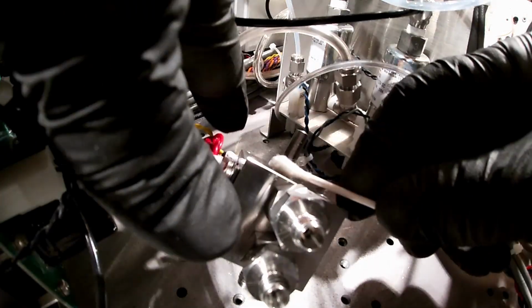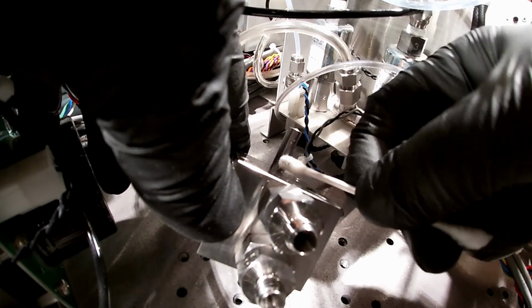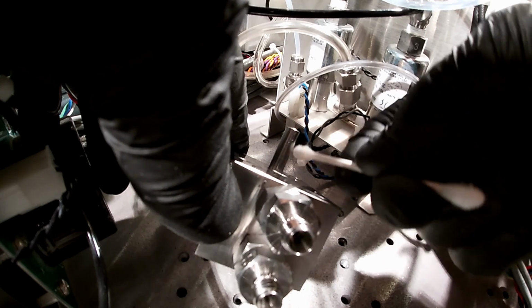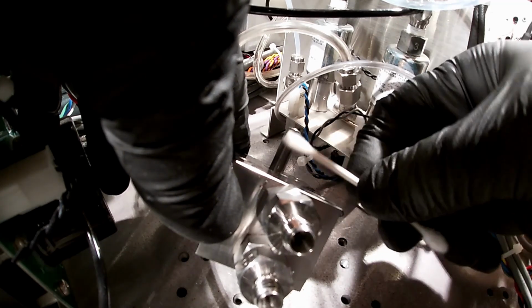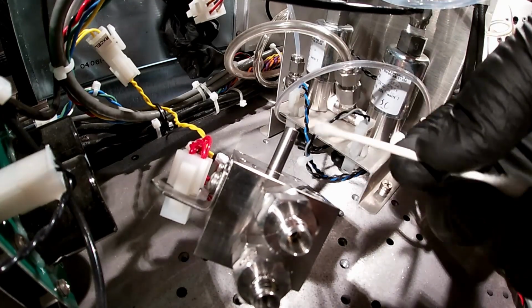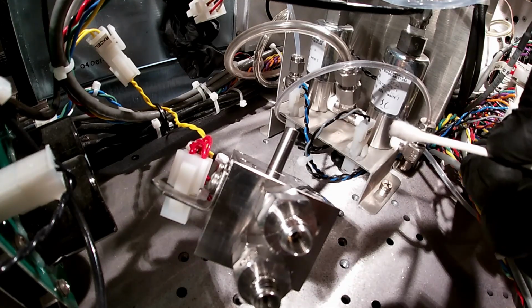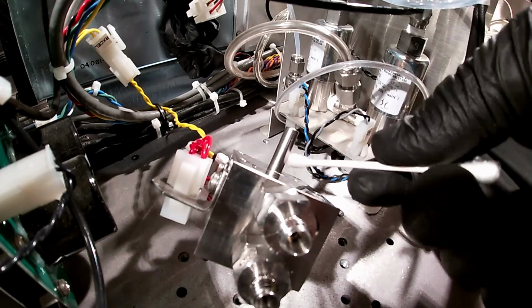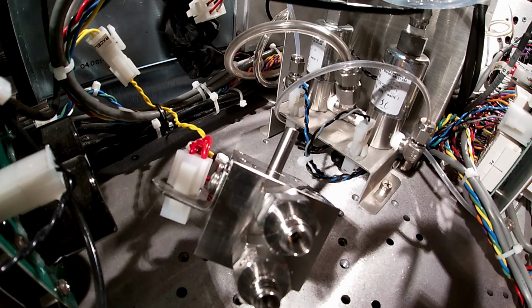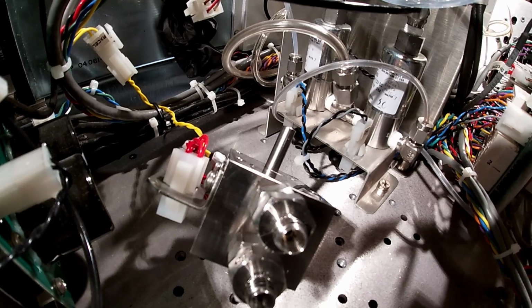And then we want to clean off any of these parts in here that we've got exposed. Just get it all as clean as we can. See the concentric tubes here where the ozone and the sample come in and are introduced to the chamber? Those are a little tricky to clean out without an ultrasonic bath, so we're not going to be able to get in there right now. Should be fine. Really what we're looking for is the surface area of the reaction chamber. That's where the dirt is going to make the most difference, getting it clean. That's where the actual chemiluminescence occurs.